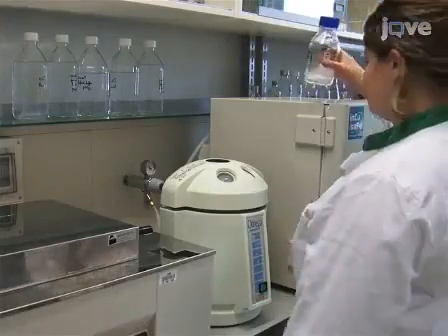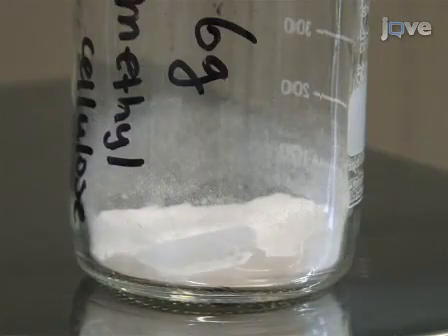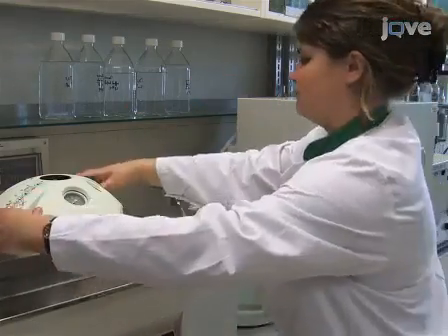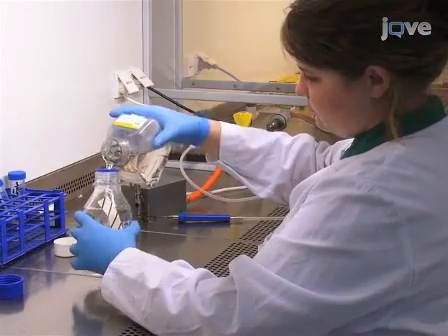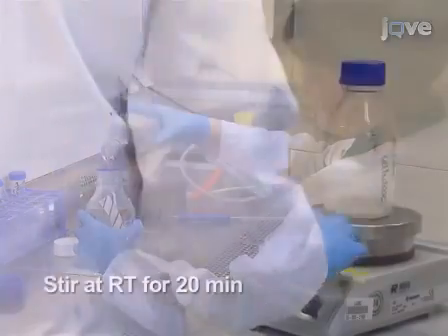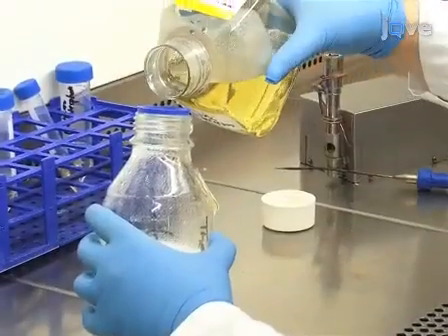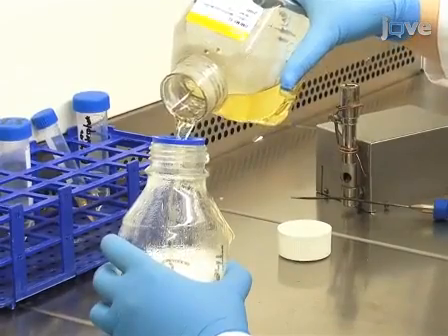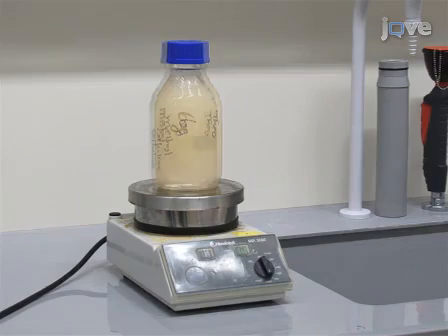To prepare methocell solution for the TGF-β-induced invasion assay, begin by autoclaving 6 grams of methylcellulose in a 500 milliliter bottle containing a magnetic stirrer. Dissolve the methylcellulose in 250 milliliters of preheated DMEM F12 without serum for 20 minutes. Add 250 milliliters of room temperature DMEM F12 containing 10% horse serum. Mix overnight at 4 degrees Celsius.